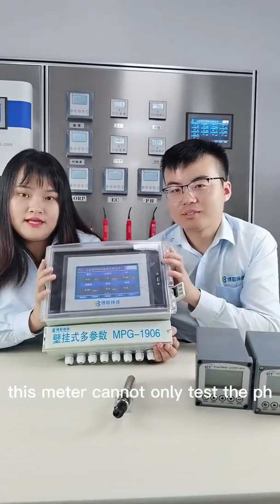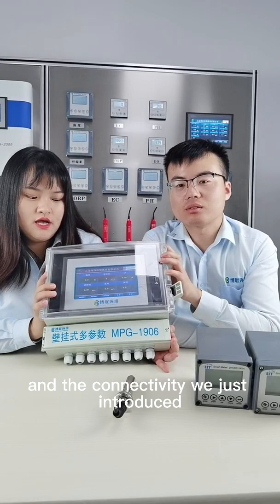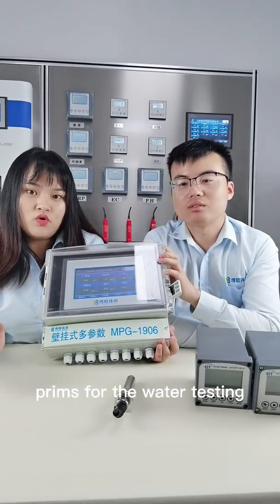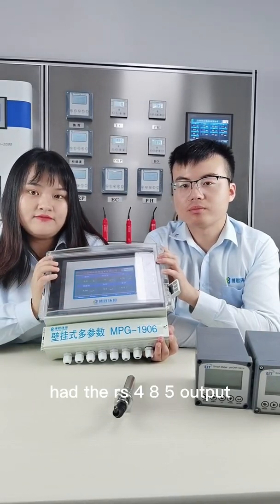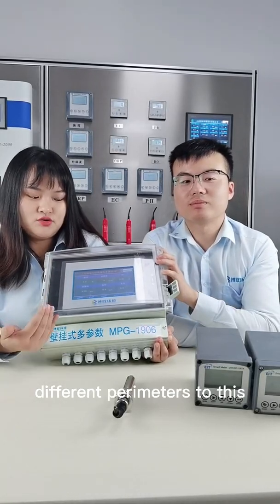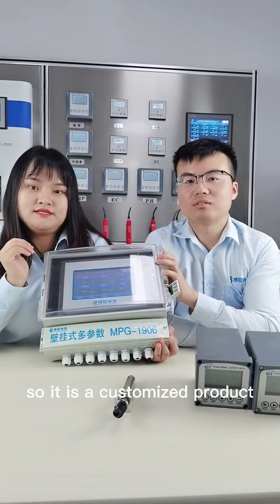This meter can not only test the pH, dissolved oxygen, and the conductivity we just introduced. It's very powerful. It can test almost all parameters for the water testing. Just connect the digital sensors which have the RS485 output. Our engineers can connect the different parameters to this controller directly. So it is a customized product.